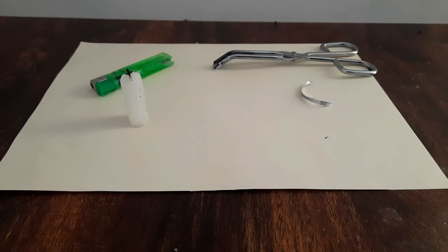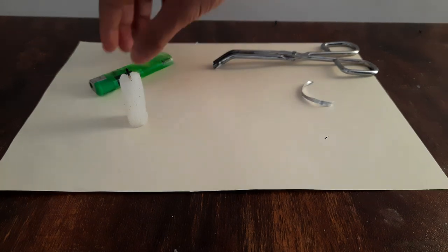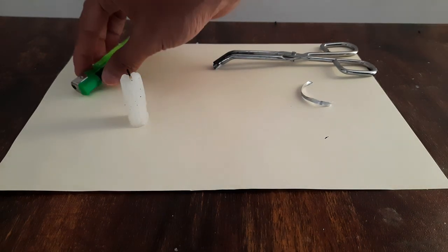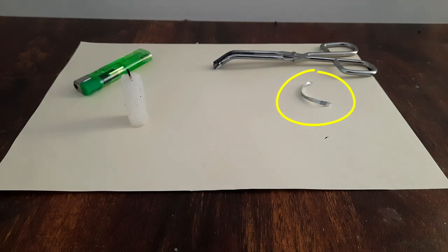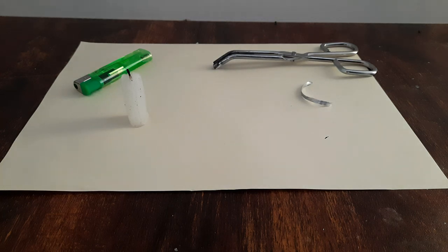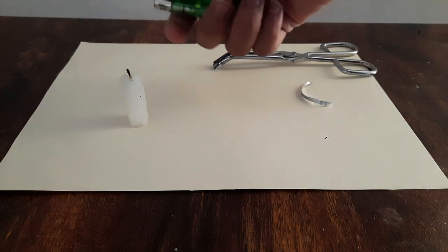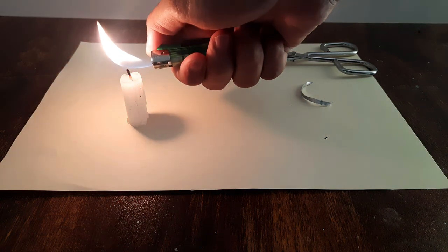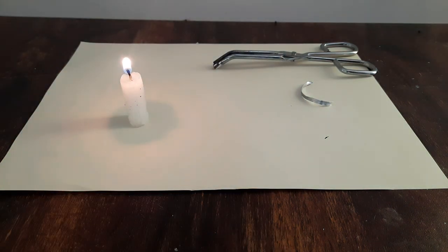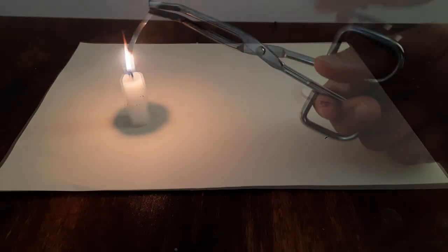Let's look at one more case. Now over here I have a candle, I have a lighter which I can use to light up the candle. I have a magnesium ribbon and a pair of tongs. So I will light up this candle and I will try to burn this magnesium ribbon. I want you to notice what happens.